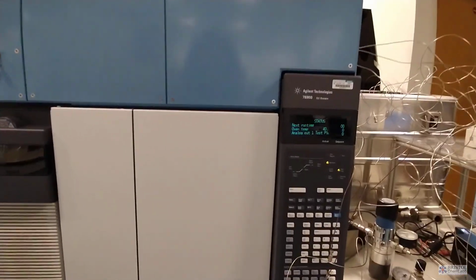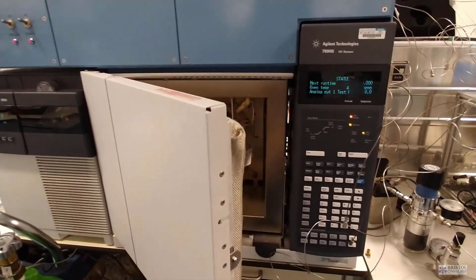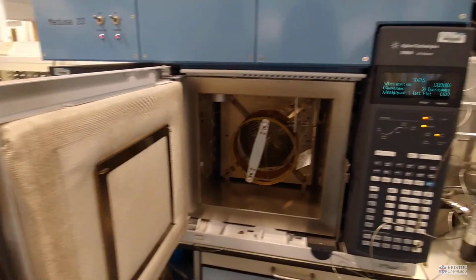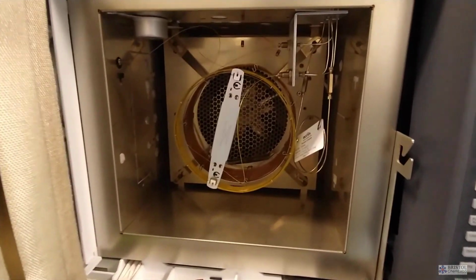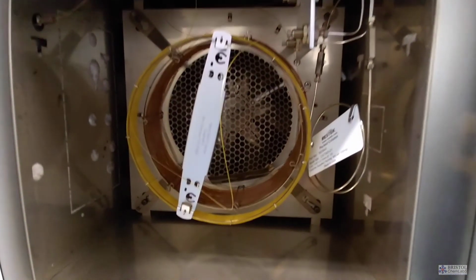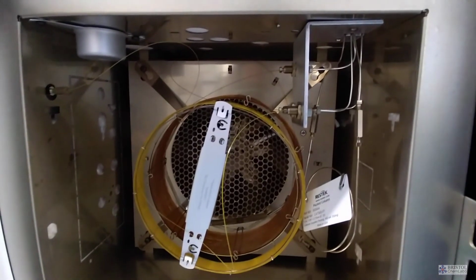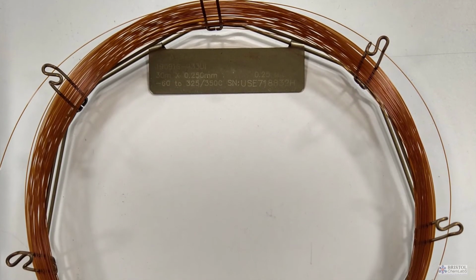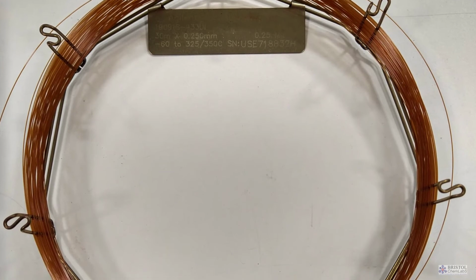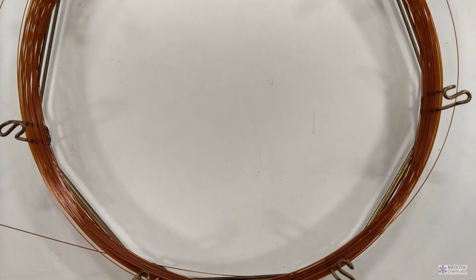There are predominantly two different types of instrumentation that we use. They're mostly gas chromatographs or light-based instruments. Gas chromatographs are basically just very fancy ovens. Inside the gas chromatograph, you have a long, thin piece of tubing. The inner diameter is a little bit bigger than a hair.